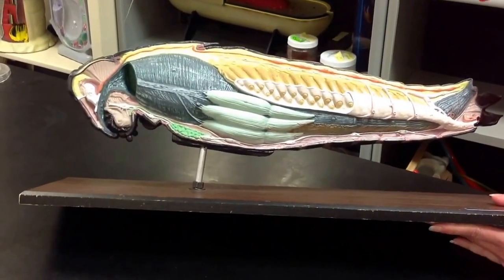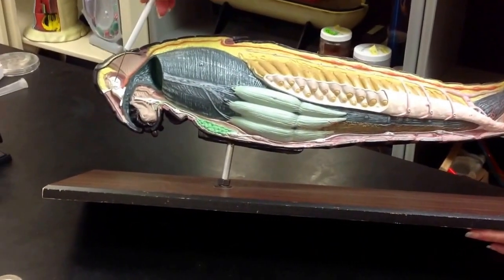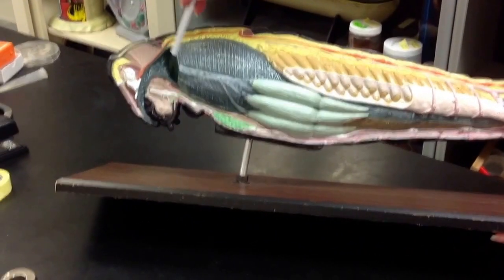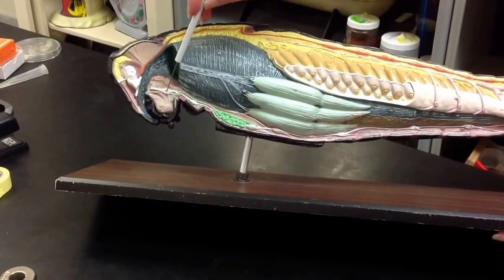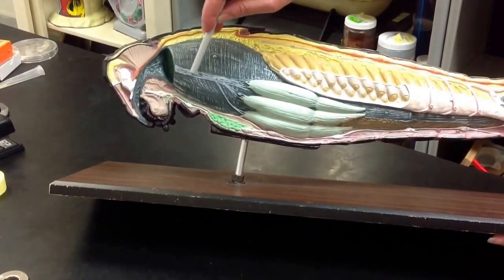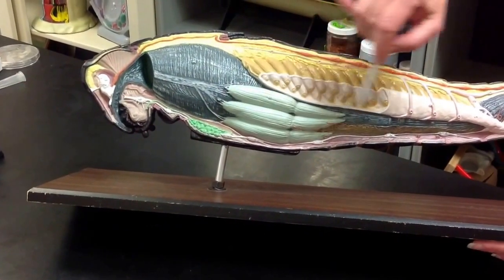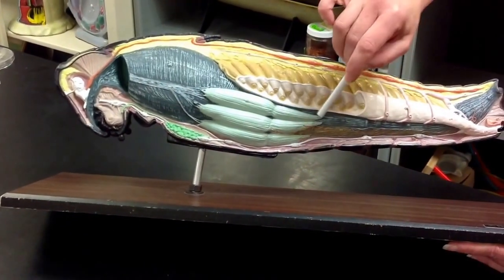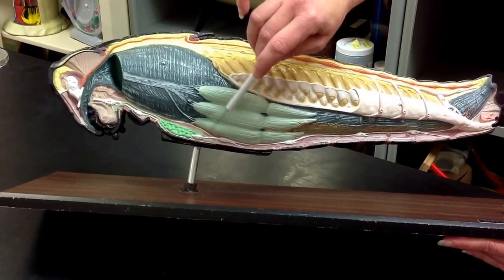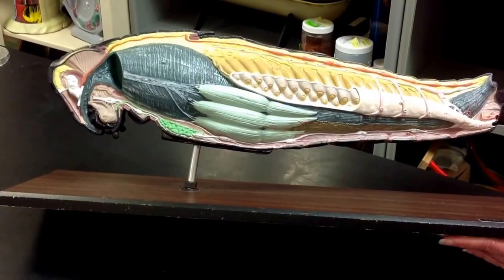I'll start with the nervous system. Here we have the supraesophageal ganglion, and here's the subesophageal ganglion. It leads into the ventral nerve cord, and each of these enlarged bundles along the ventral nerve cord is the ventral nerve ganglion.